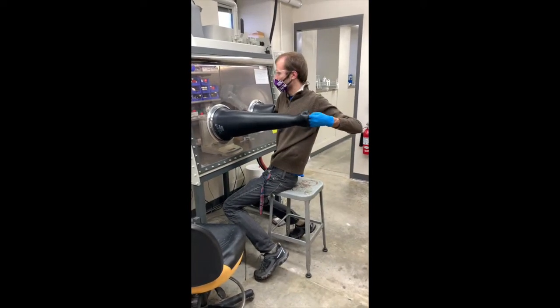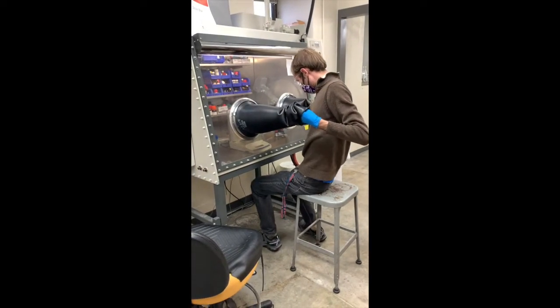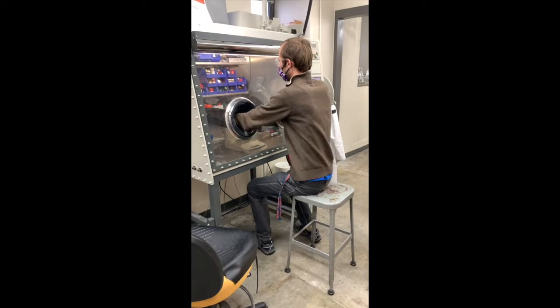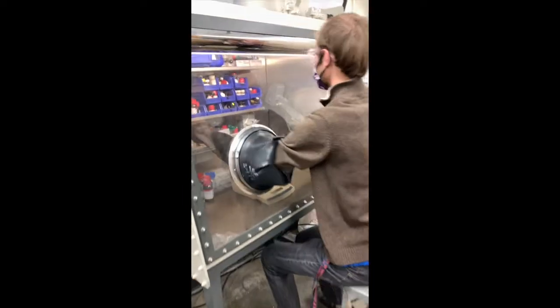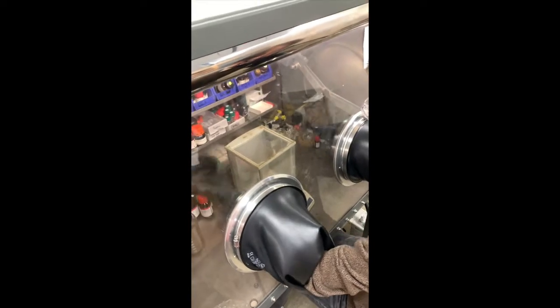Okay, so I'll get my second arm in here. Now we are ready to get our reagent.